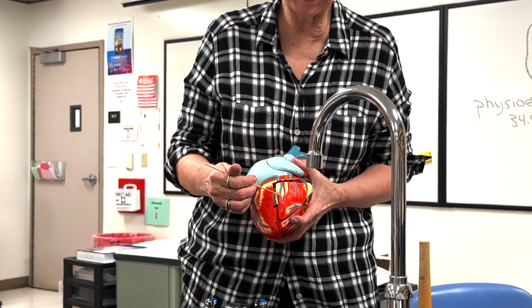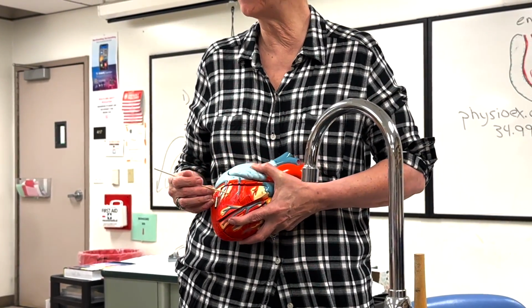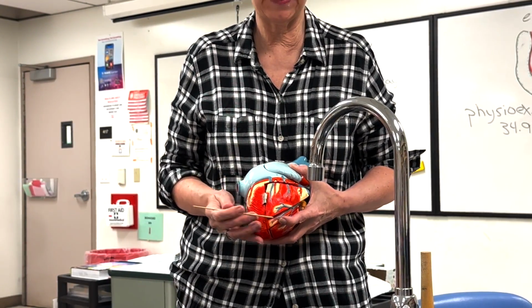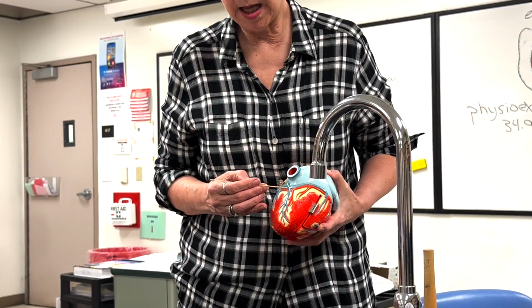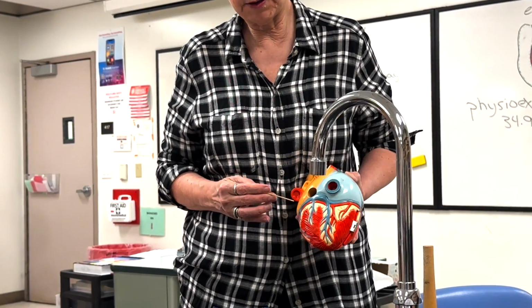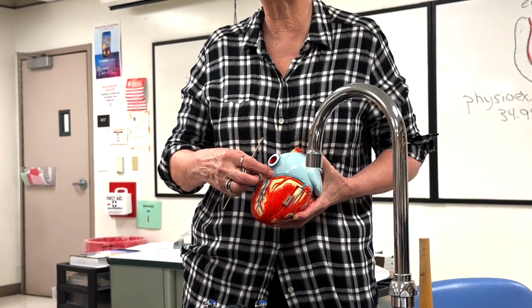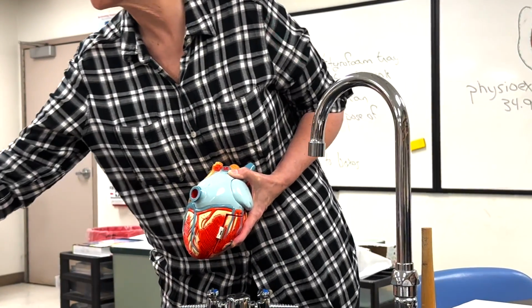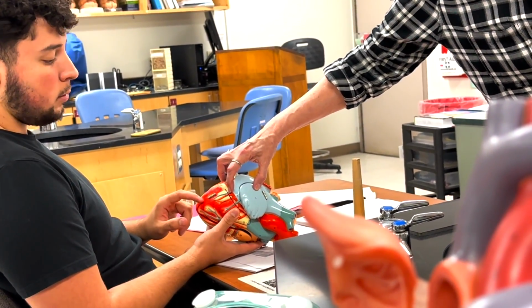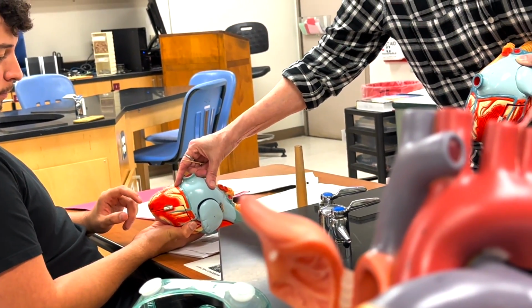So with the marginal artery, we have the small cardiac vein coming around to the coronary sinus, and that's one way to find the marginal artery. See how that makes a right angle turn? So if you see that, then you know that that's the marginal artery, okay? And then coming up from the posterior interventricular artery, we have the middle cardiac. So great cardiac forms the coronary sinus, small cardiac and middle cardiac drain into this end of it here just before it gets into the heart. Small cardiac is going to start in the front. So it's going to start here where it makes that bend and travel all the way around till it empties into the coronary sinus. And then that would be the middle cardiac.